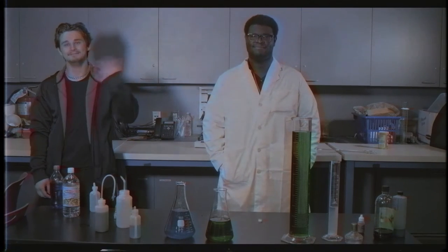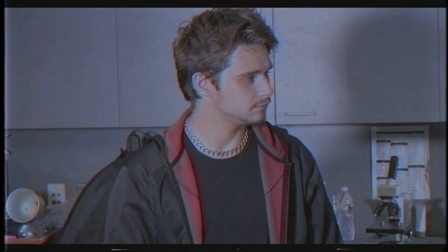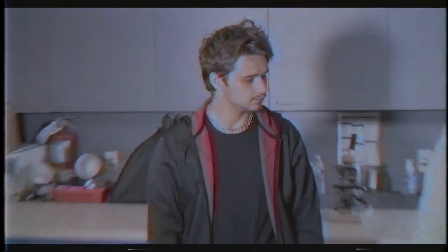I'm Looney Rob! Let's see what we have over here. Two flasks, both filled with some type of mysterious liquid. I'm kinda thirsty. In this situation, it would be best to leave the lab to get a drink of water. Hey, don't ever drink or eat anything in a lab if you enjoy living.